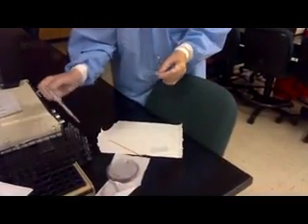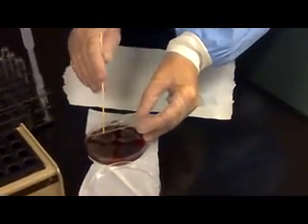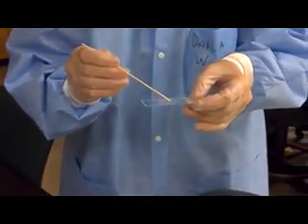Take a small drop of 3% KOH onto the slide. Then you want to add a generous amount of specimen — you want to make sure you have plenty to get a good reaction because this is a visual test. Then add your specimen to the KOH and begin mixing in a small circular motion.